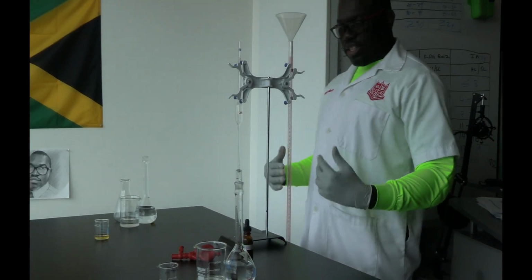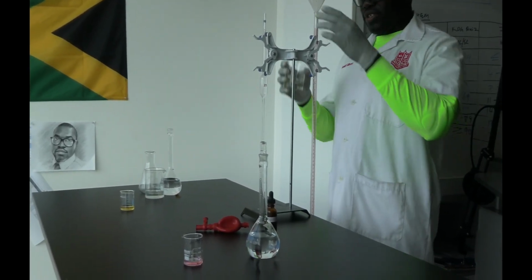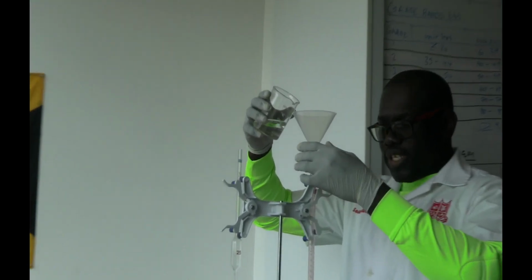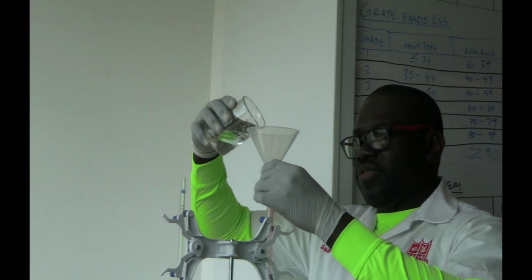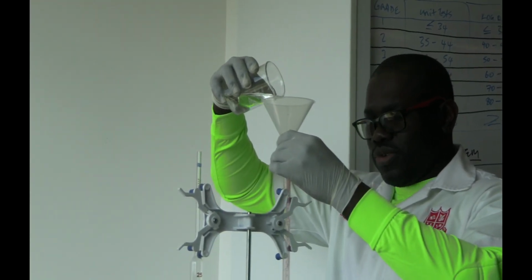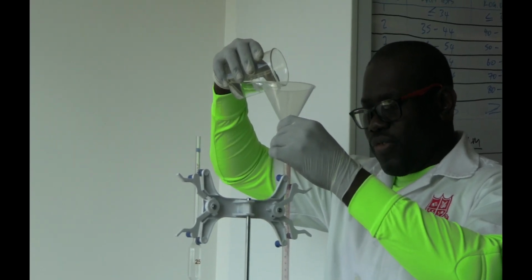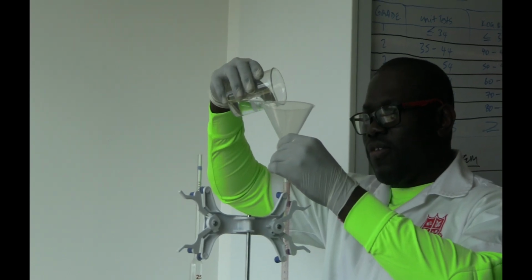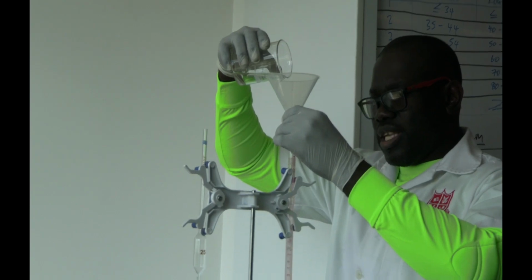and we're going to put in the burette hydrochloric acid. So make sure the valve is closed. Lift the funnel when you're filling it, because if you don't lift it, what will happen is it will reach all the way up to the top and you think it's not full as yet. So just lift it so you know the exact amount that's in there. And I'm not going to fill it to a specific amount. I'm just going to allow it to go above the 0 line. That's all.